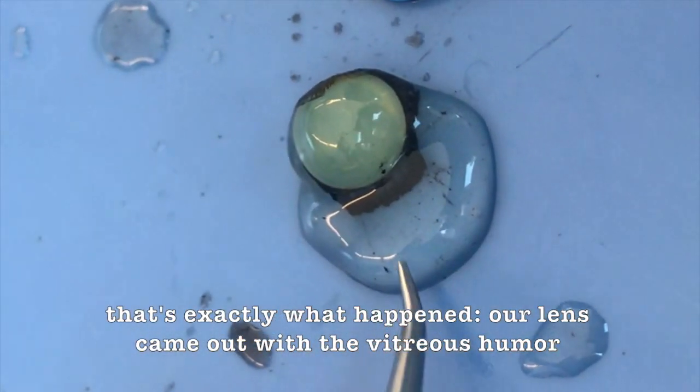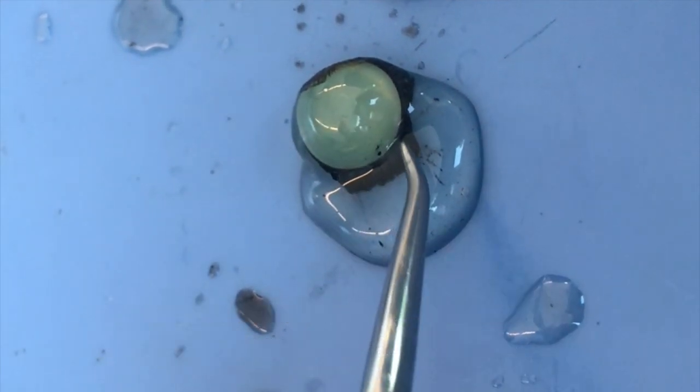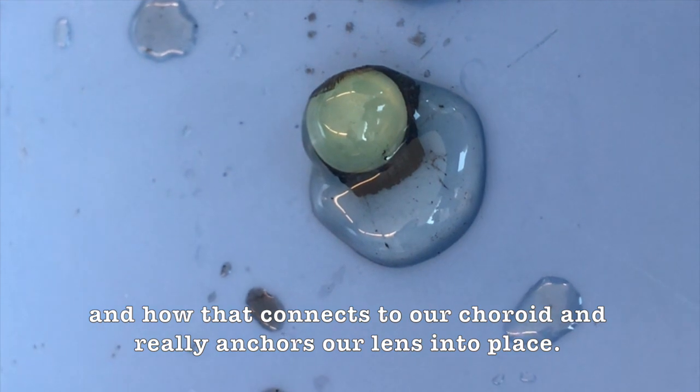Our lens came out with the vitreous humor, but it really demonstrates the suspensory ligaments here and how that connects to our choroid and really anchors our lens into place.